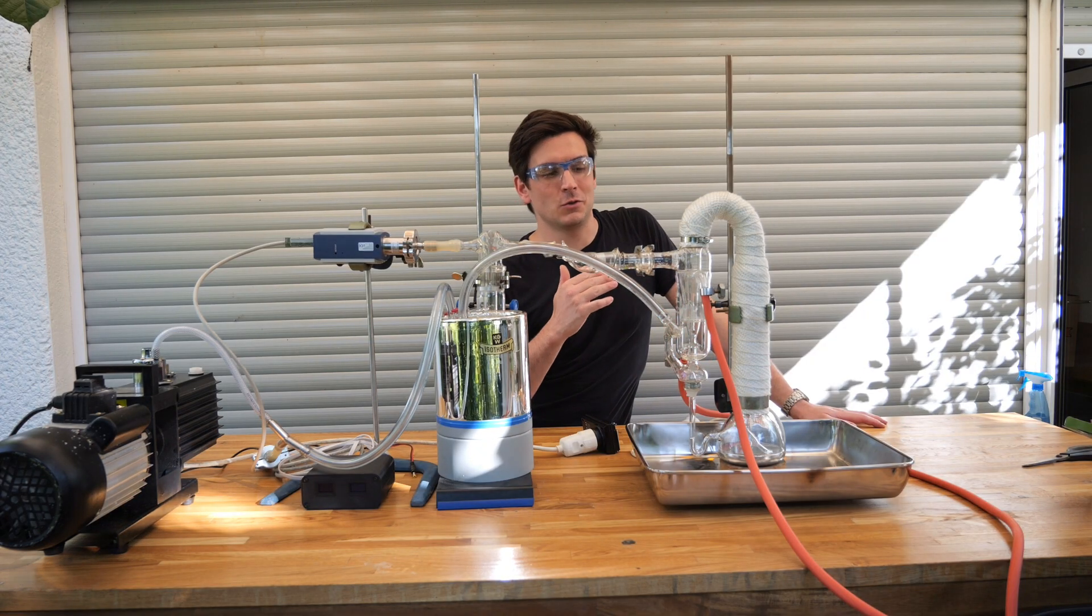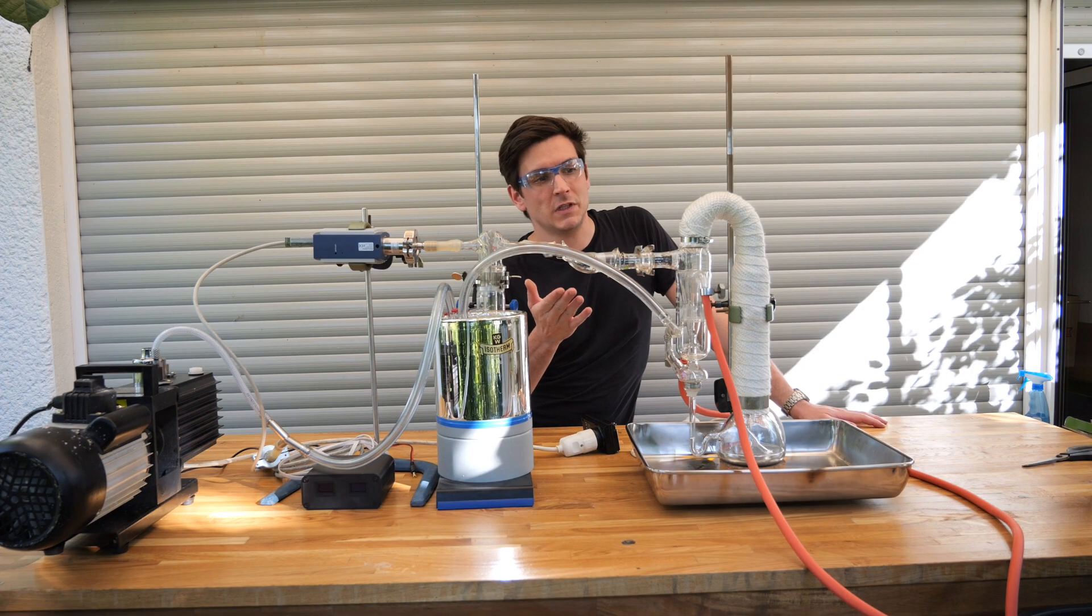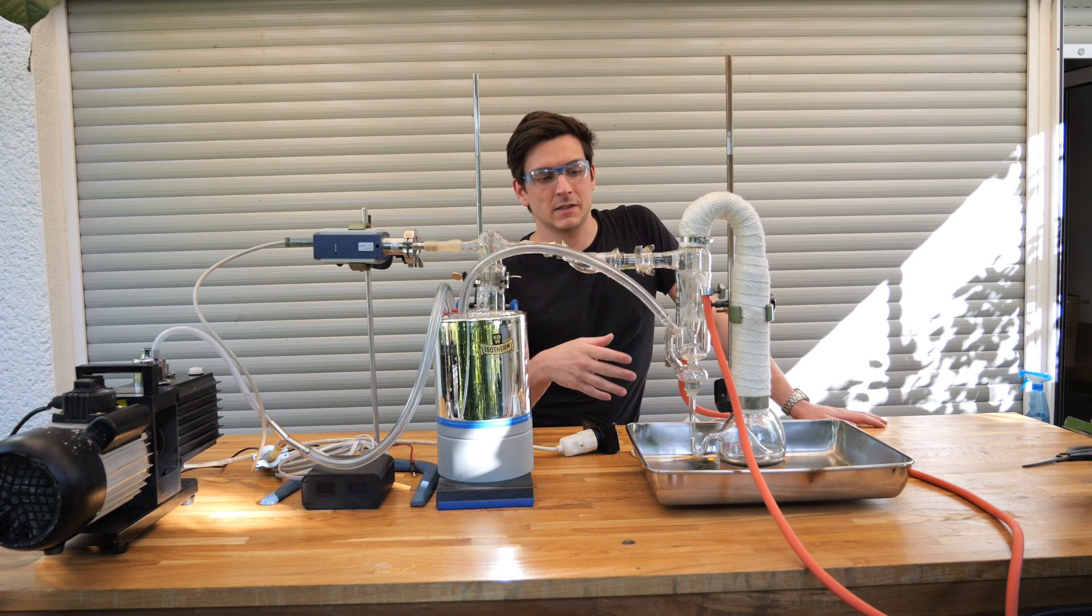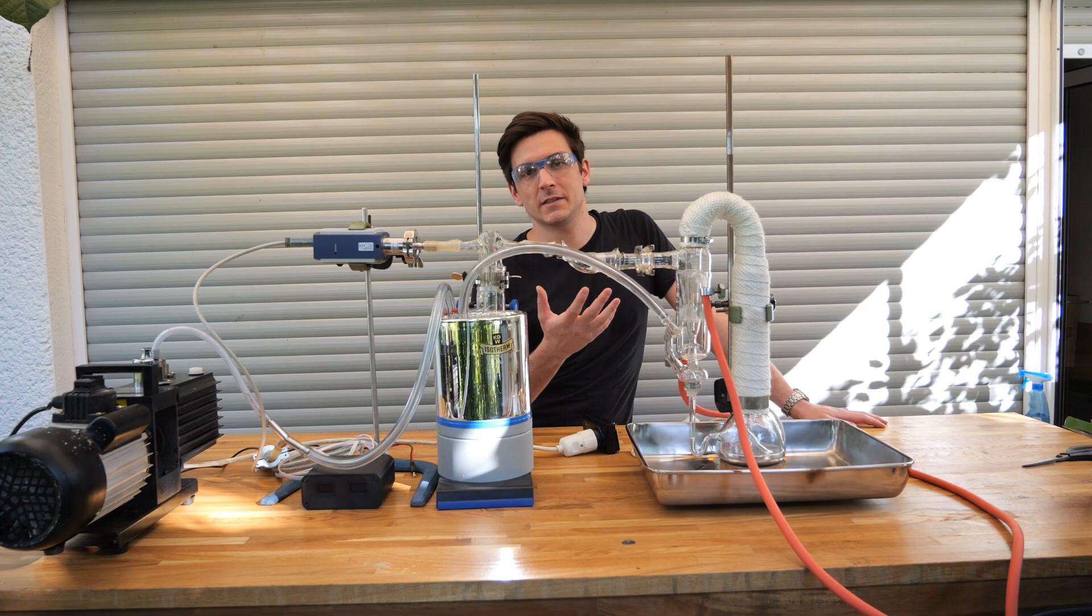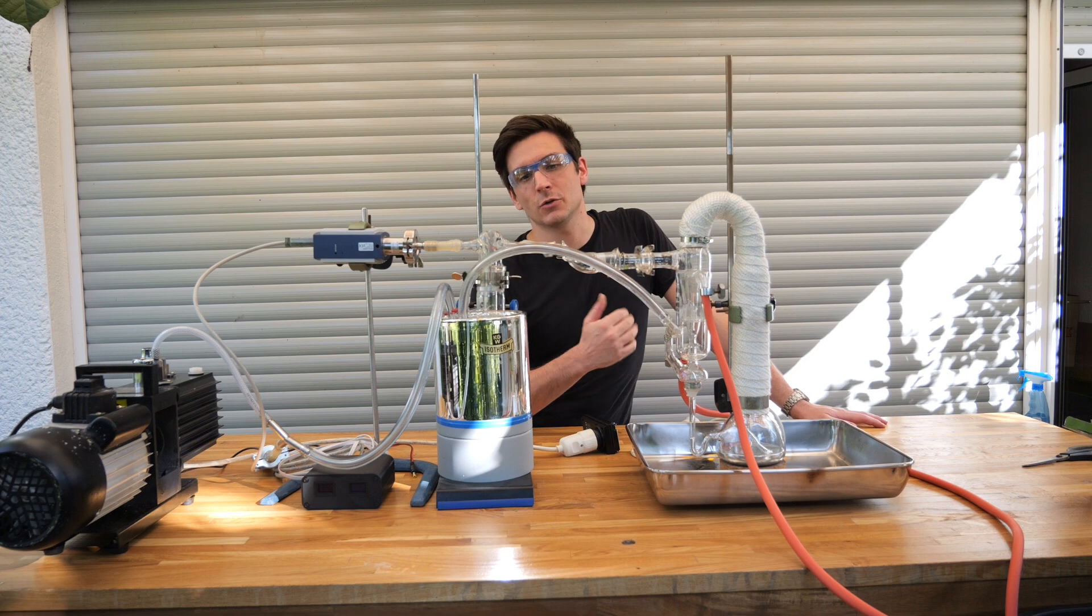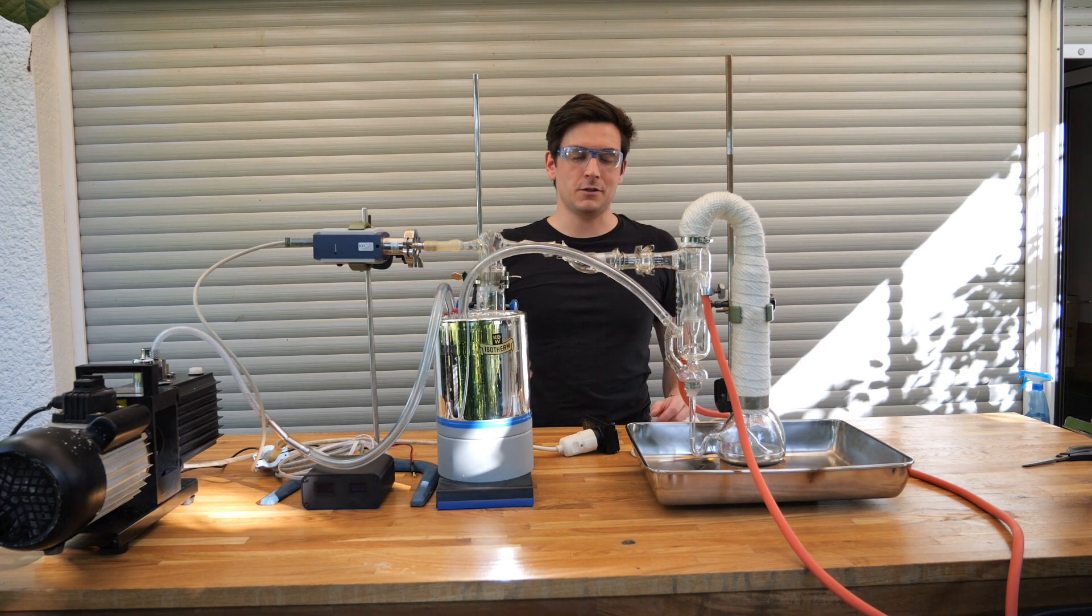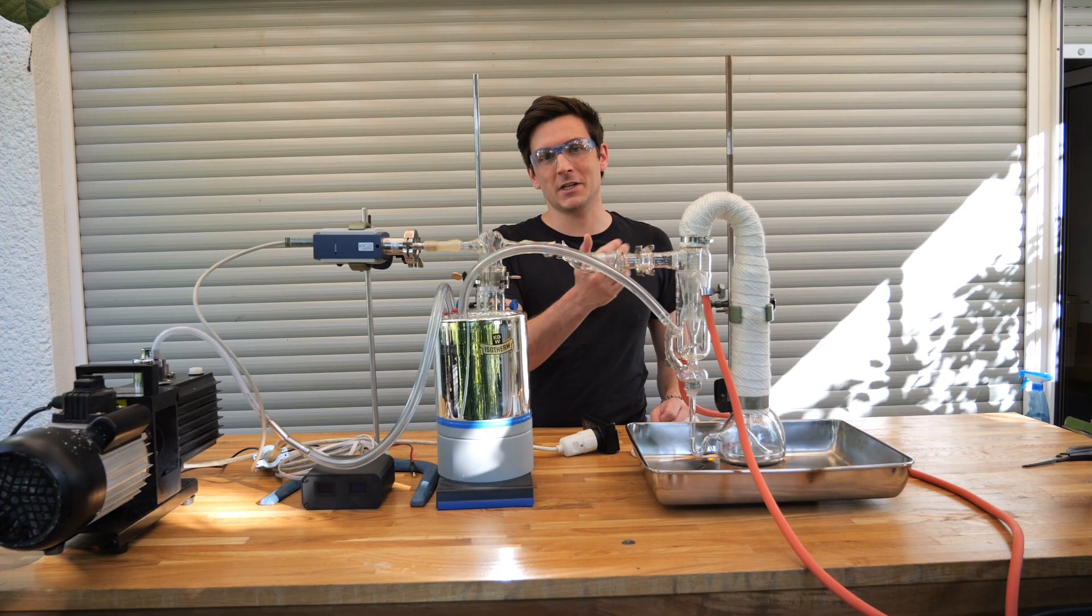I'm definitely not man enough to let this pump run in my home, but some of you wanted to see a mercury diffusion pump in action. Since I got one from the same person that gave me his Schlenk setup, I thought it would be a shame to never use it. So today I've set up everything that is needed and you and me for the first time can see this pump run.